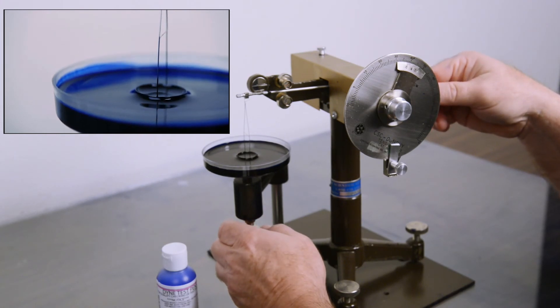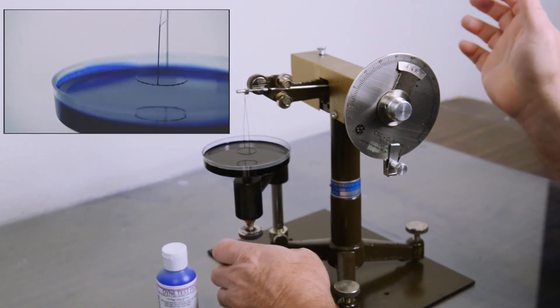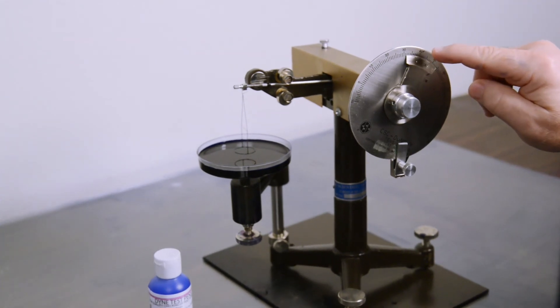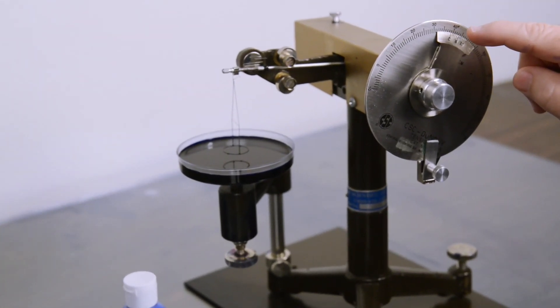We are going to start looking to see where the bubbles break, which it breaks and it is showing at 39, which is one below, which is 38, so we have an accurate solution.